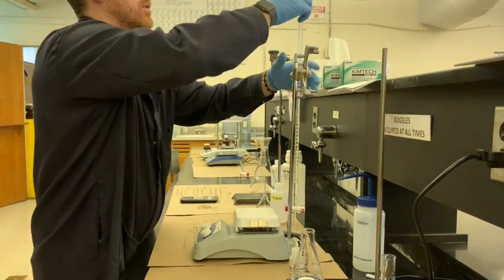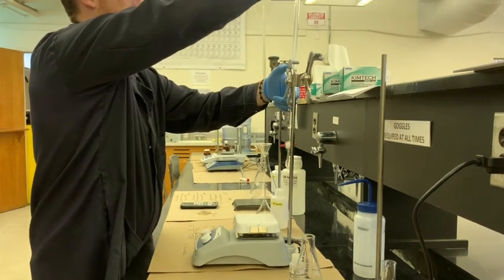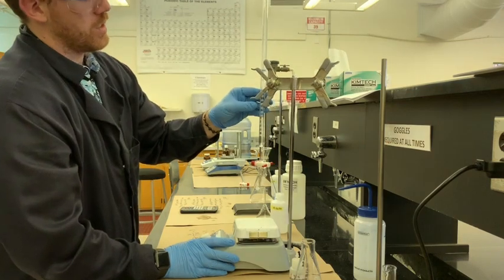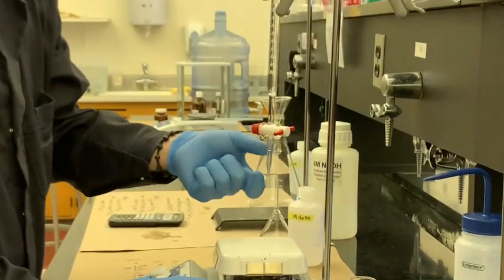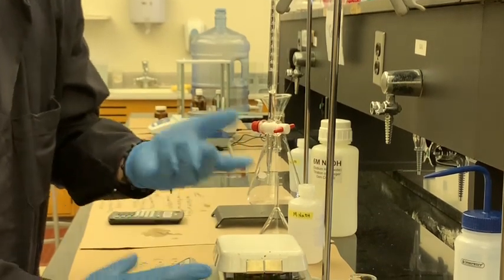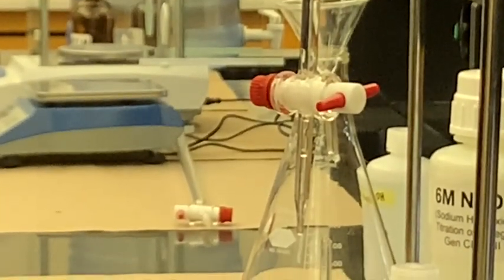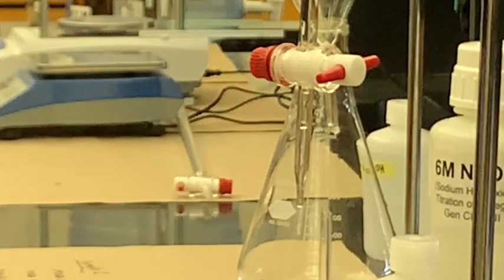Next thing we're going to do is lift this up and get it in position so we can take our first reading. And the last thing you want to do before you're ready to go on any titration is remove the bubble. That's very critical. If you don't remove the bubble, this volume in here is full of air, and that air can be compressed, it can affect volume, and that's not what we want when we're trying to take a specific amount of liquid that we're trying to measure here. We want very specific numbers, and if you have any kind of gas, it's going to affect volume.